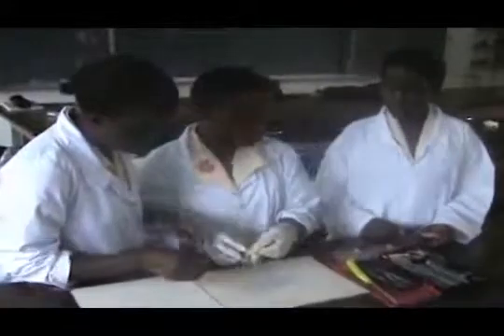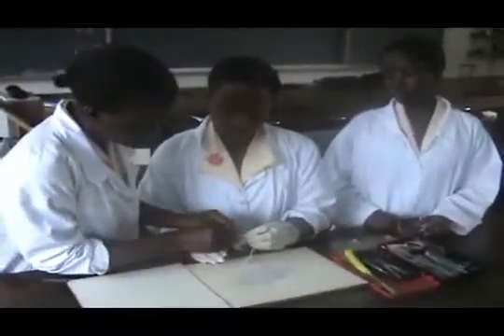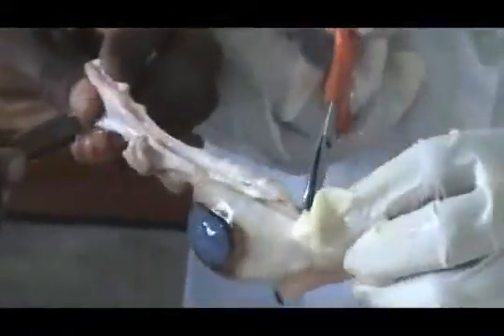We now cut off the fat. Since the fat is slippery, an incision is made with a blade. Then scissors are used to cut through it and eventually cut it off. After the fat has been removed, the optic nerve can be seen.